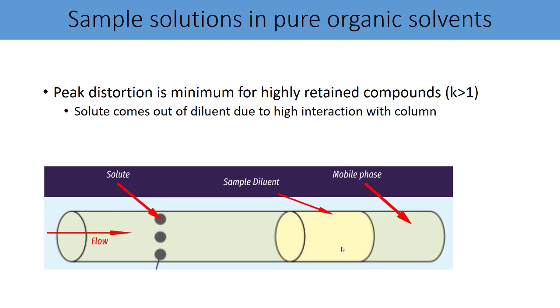Similarly, if you are using a stronger organic solvent as a diluent, I mean your diluent is stronger than your mobile phase, and the analyte has a higher retention time, then the chance of distortion is minimal. The reason is your solute molecules will come out of the diluent because of their high interaction with the stationary phase. Now look at the screen and you will understand what I mean.